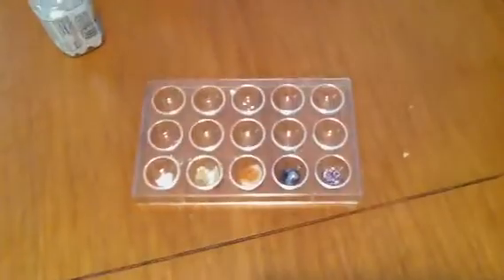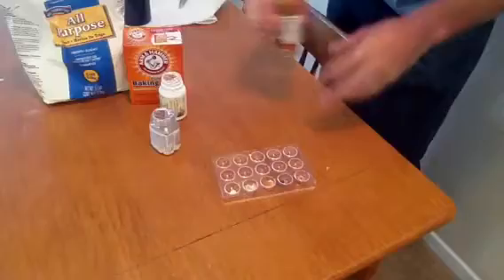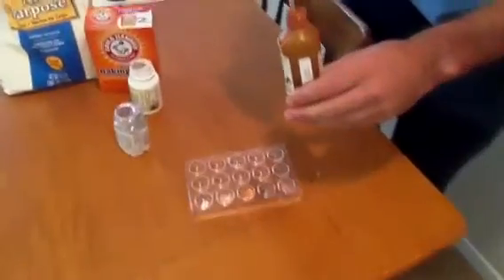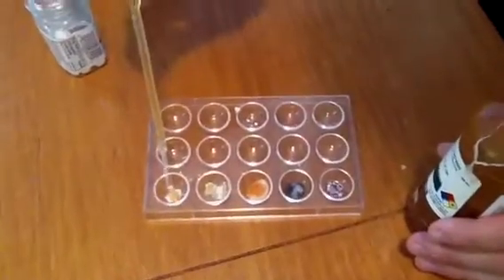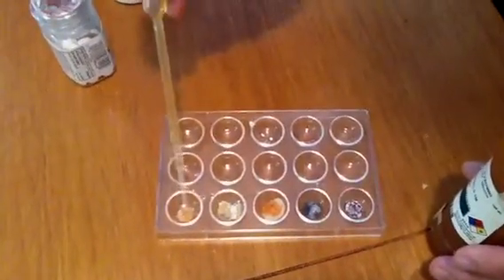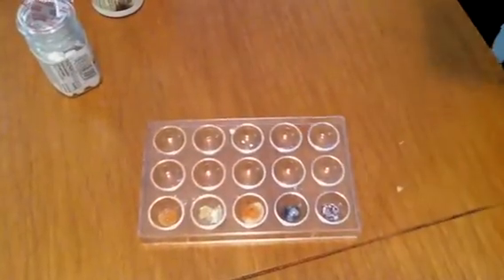Okay, and the goal here, let's say we found this at a crime scene, at a drug bust or something like that, is that we now have to identify this white powder. And so that means we're going to test it again with iron nitrate. Okay, so we see the reaction there. What do you guys think that is? I'll let you figure it out. I'm not going to tell you.